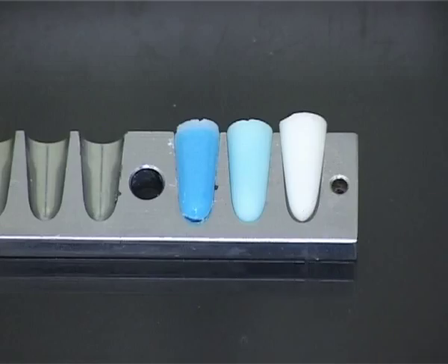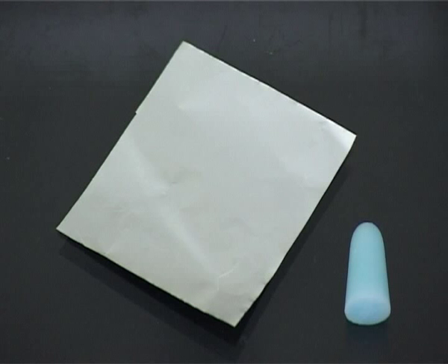Here you can see what can happen if the molten base and insoluble medicament are not well stirred together. The white suppository was probably the first to be poured and contains no medicament. The bright blue suppository was probably the last to be poured and contains more than its share of medicament. These are obvious errors when compared with the accurately made suppository in the centre.